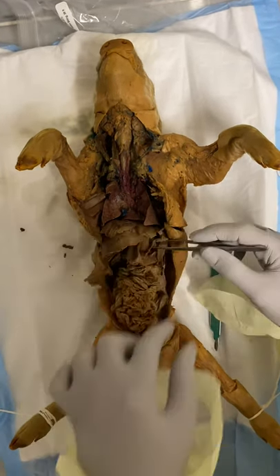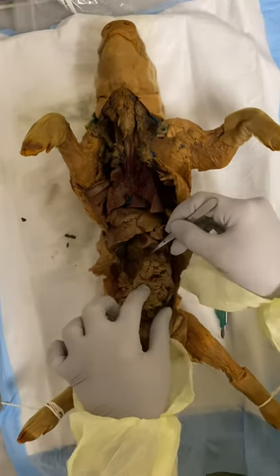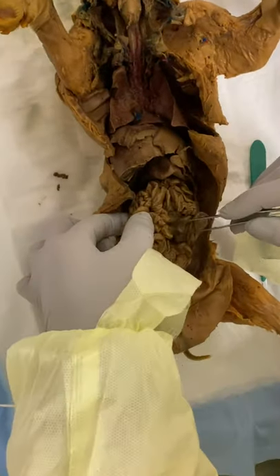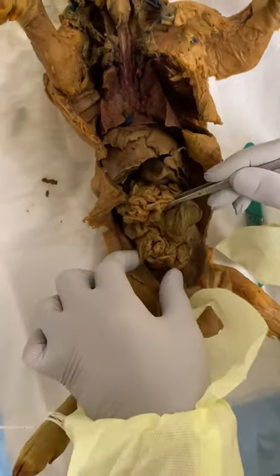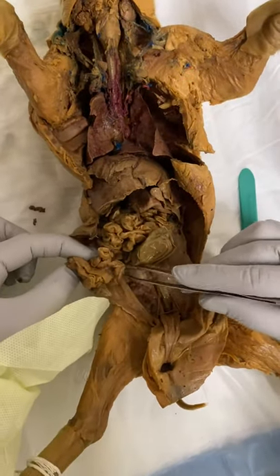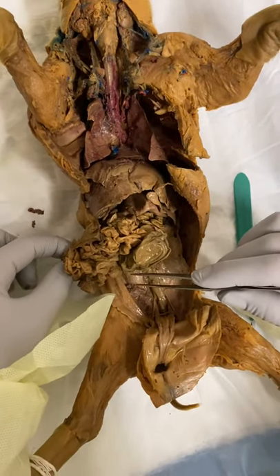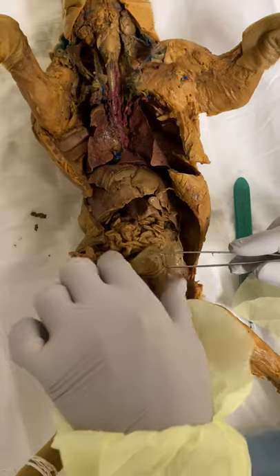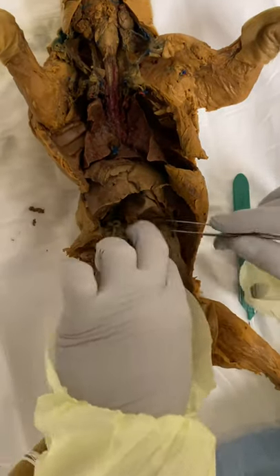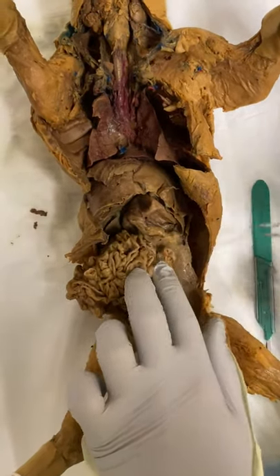Moving to the small intestine, starting with the duodenum, and then it moves into the jejunum, and then ends with the ileum, and then runs into the large intestine. And then the pancreas is hidden right here.